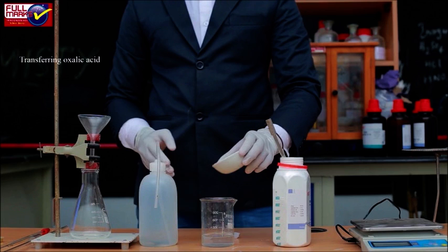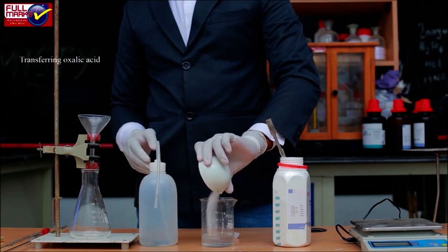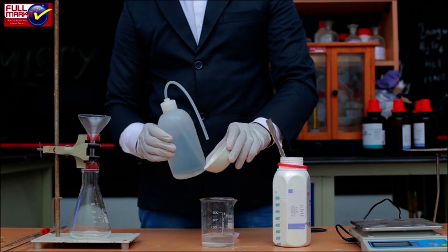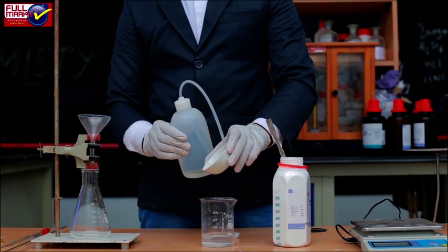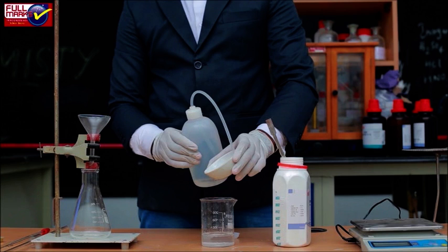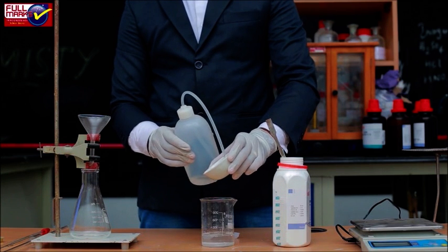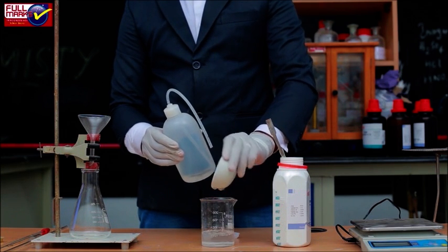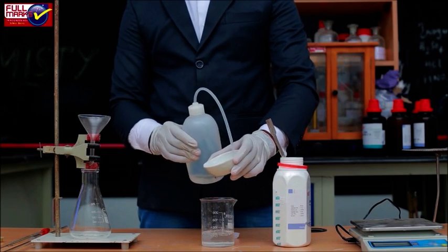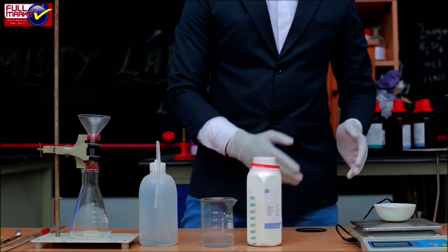Transferring Oxalic Acid: Carefully transfer the oxalic acid from the watch glass to a beaker. Wash down any oxalic acid crystals from the watch glass that have stuck, using distilled water. Weigh the empty watch glass to find the exact weight of oxalic acid transferred to the beaker.